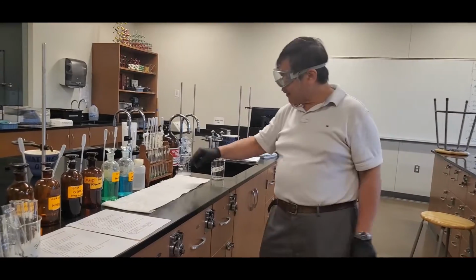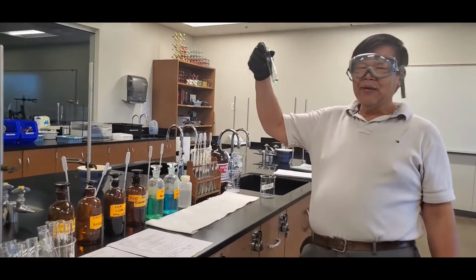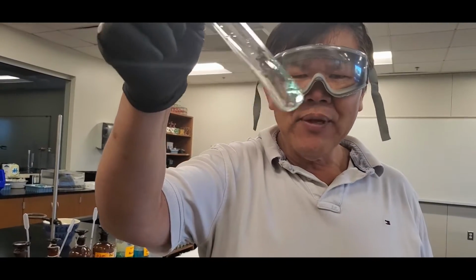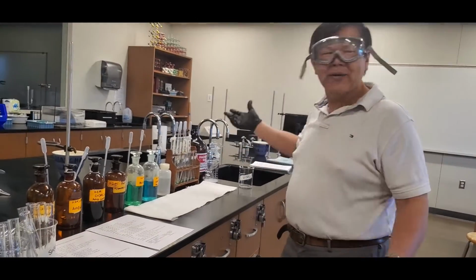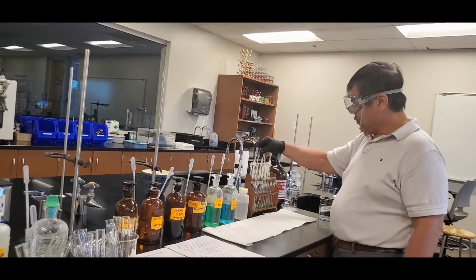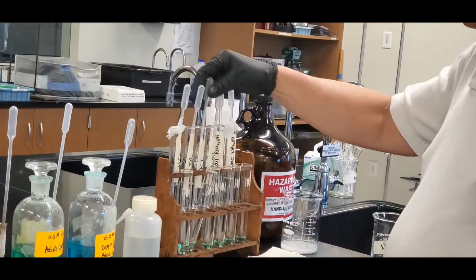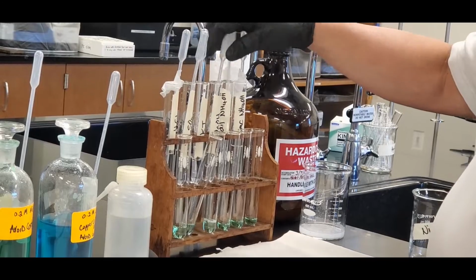Okay, guys. Next one. Next to last. This is the nickel 2 nitrate. Now, the color of this particular solution is kind of greenish, okay? Originally. Now, what we do is that same procedure again, okay? So, deeper voice. Hydrochloric acid. Sulfuric acid. Potassium iodide.